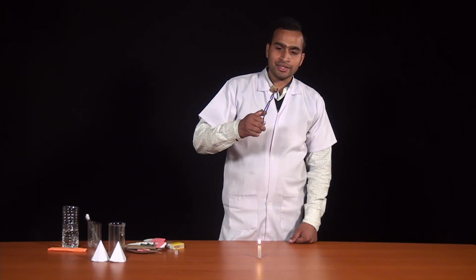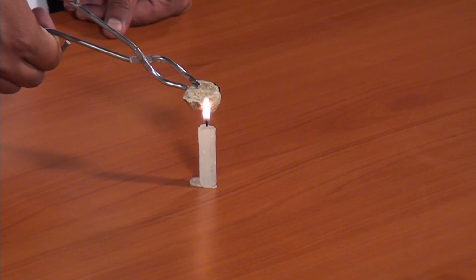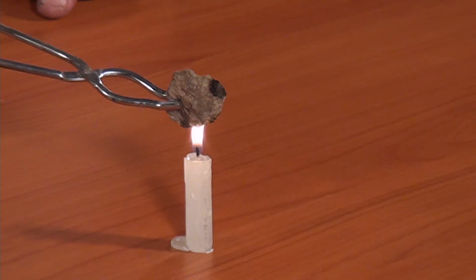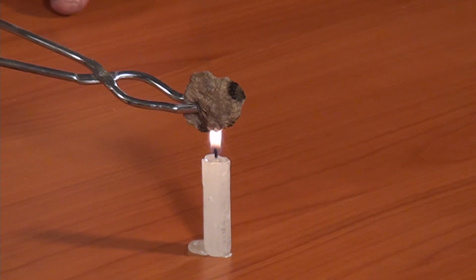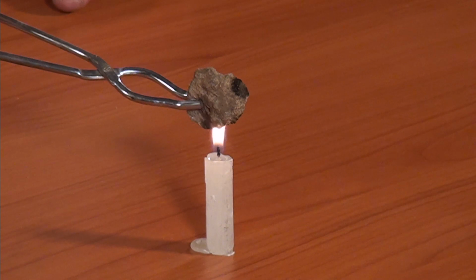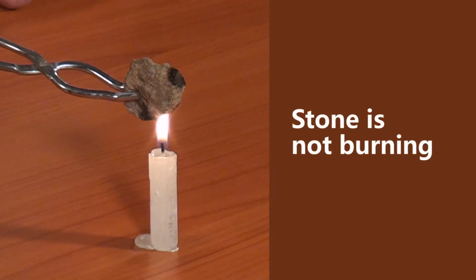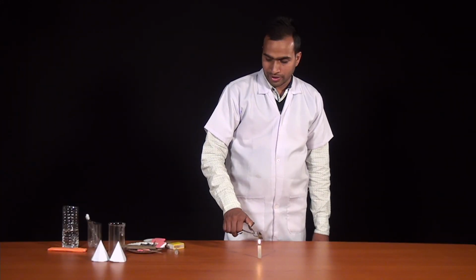Can you identify this? Yes, this is stone. This is a piece of stone. Let's try to burn it and see what is happening. You can see that when we are trying to burn this stone, it is not burning. So nothing is produced from the burning of this substance. You can say that this substance is not burning.